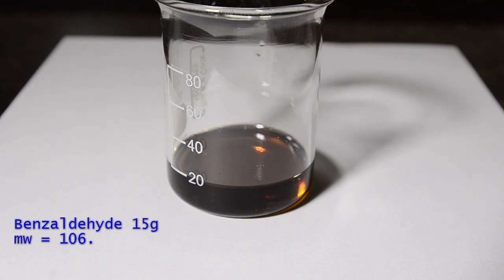First measure out 15 grams of benzaldehyde. Ours is a bit discolored but relatively pure and free from benzoic acid.